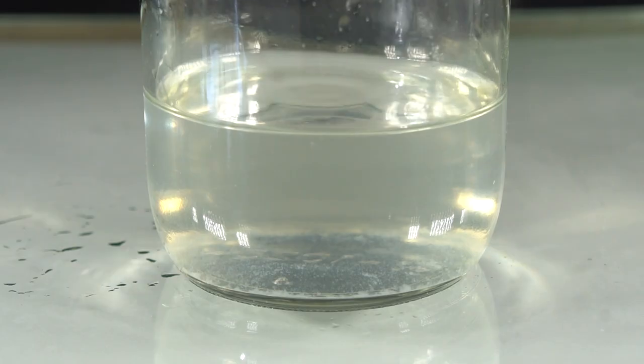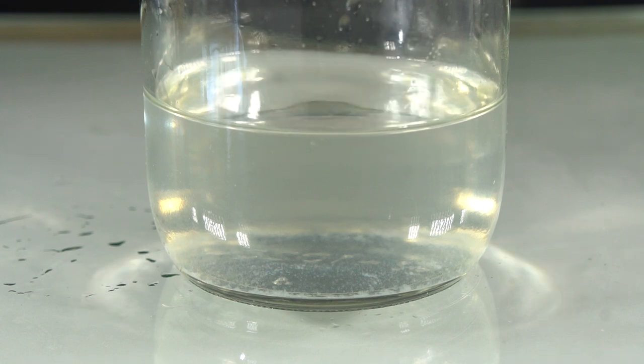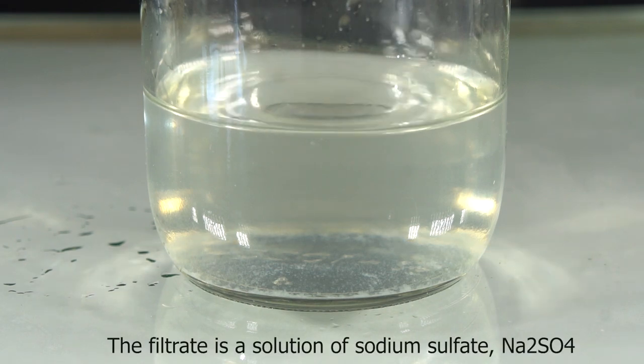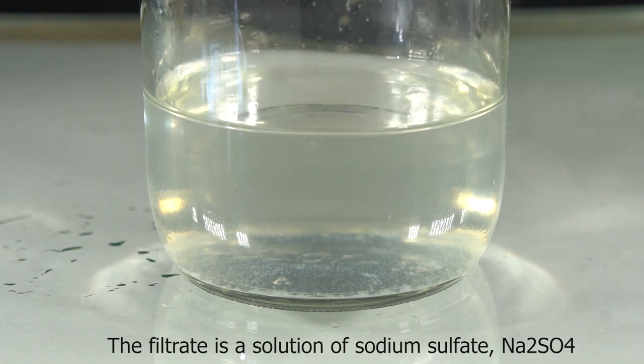The remaining clear solution, the filtrate, has sodium sulfate in solution. If you let all of that water evaporate, you will be left with sodium sulfate crystals.